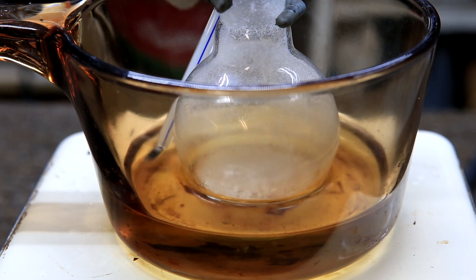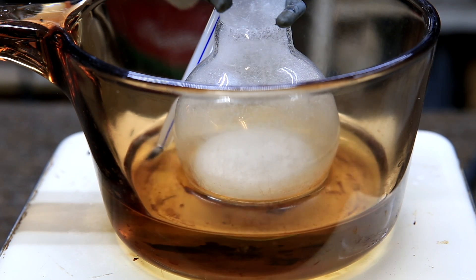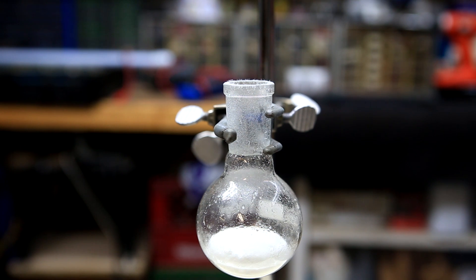Several minutes after reaching 135 degrees Celsius the mixture will froth up and this will signify the end of the reaction. The flask is removed from the oil bath and allowed to cool until room temperature.